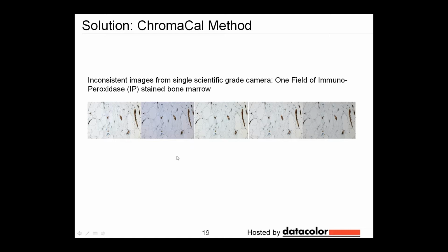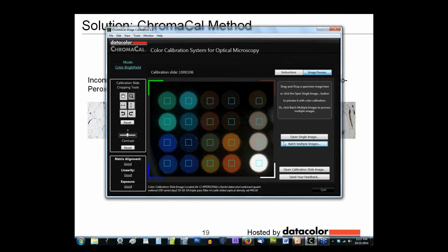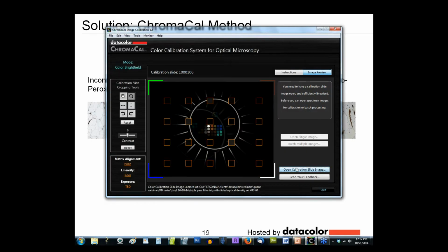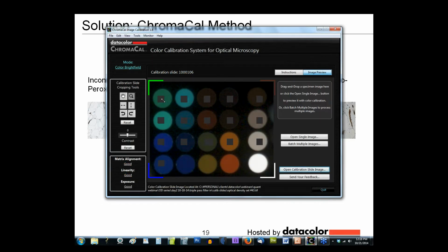So if I had this set of images and I wanted to correct these and make these consistent, I can go into ChromaCal to do that. What I would do first is open the calibration image. Once I have that calibration image, I would align it correctly, and then enlarge it and move the grid over the color patches. Now you'll note down in the lower left that there's a quality control set of prompts. In this instance, it's telling us that our matrix alignment's good, our exposure is good, but most importantly, it's telling us our linearity is good. In other words, it checks to make sure that your camera system is producing linear images.